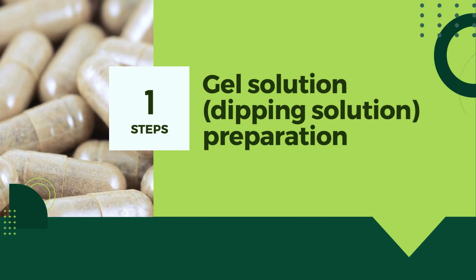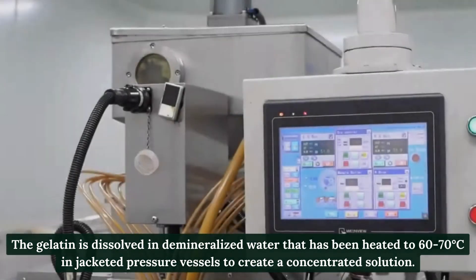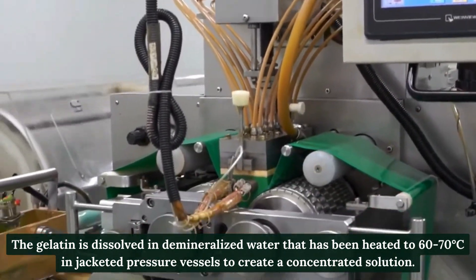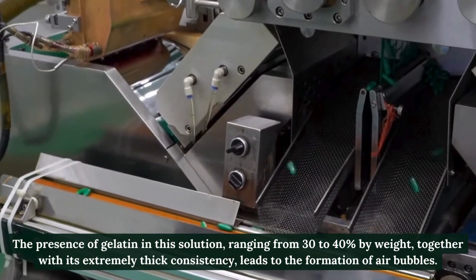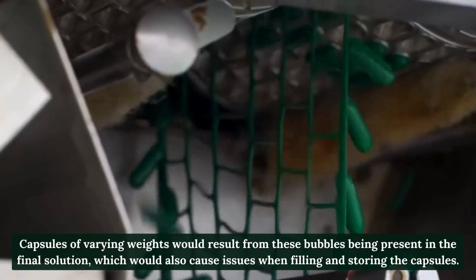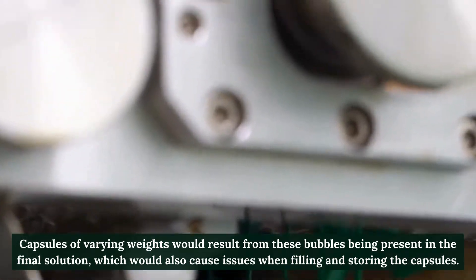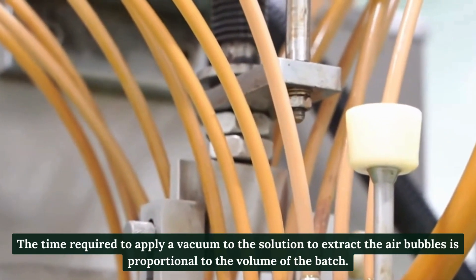Step 1: Gel solution and dipping solution preparation. The gelatin is dissolved in demineralized water heated to 60–70°C in jacketed pressure vessels to create a concentrated solution. Gelatin in this solution ranges from 30 to 40 percent by weight. Its extremely thick consistency leads to the formation of air bubbles, which would cause varying capsule weights and issues when filling and storing. A vacuum is applied to extract the air bubbles, with the time required proportional to the batch volume.